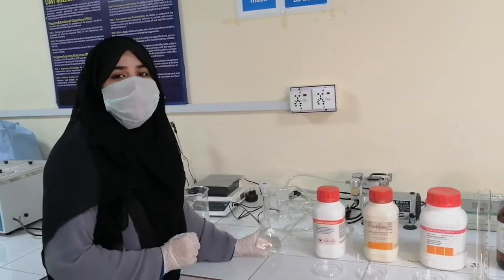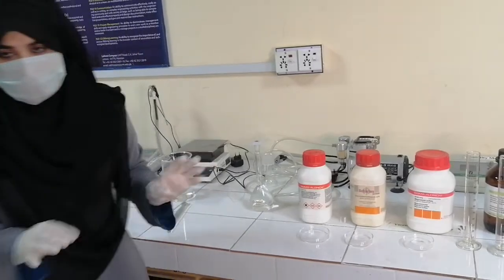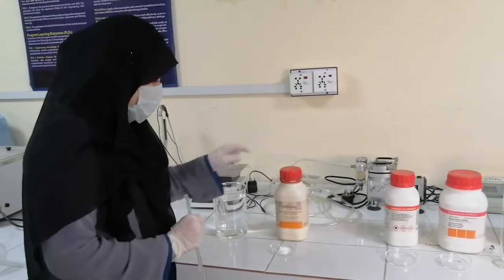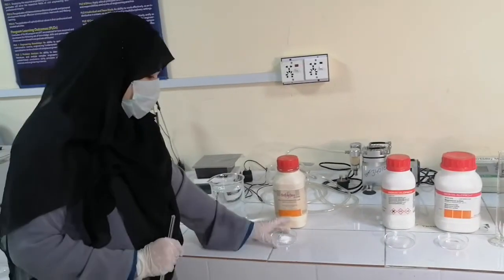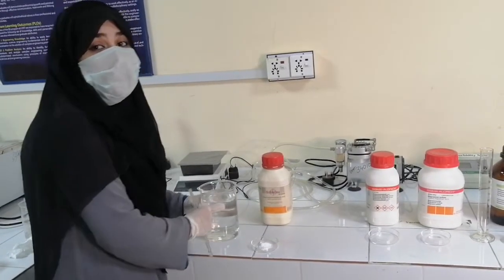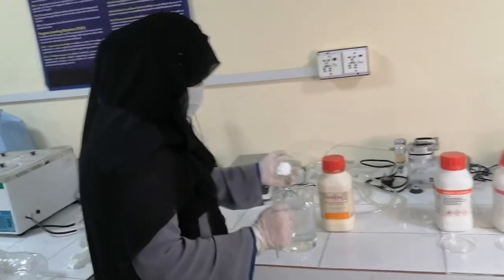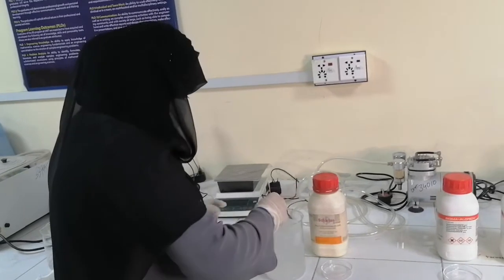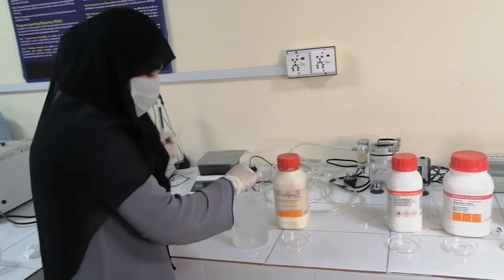Now we are ready to put the ammonia buffer aside, and we will prepare our 0.02 normal EDTA solution, which will actually be required as a titrant. We have to prepare the reagent of 0.02 normal EDTA solution. Here we have 3.7 grams of EDTA to mix in 1000 ml of distilled water. Mix it properly. Now our EDTA solution is ready.